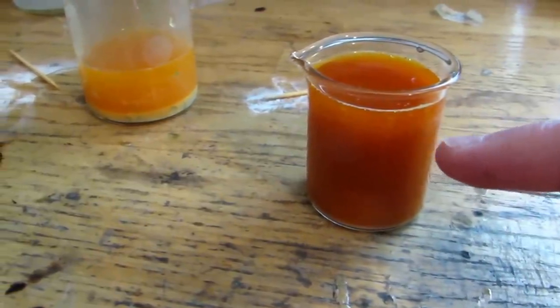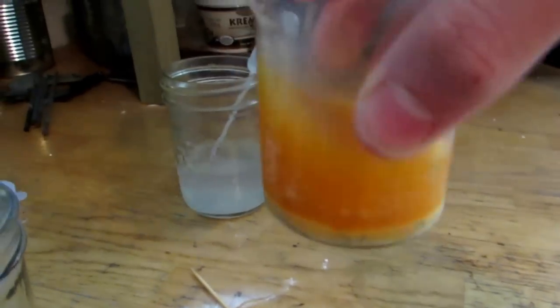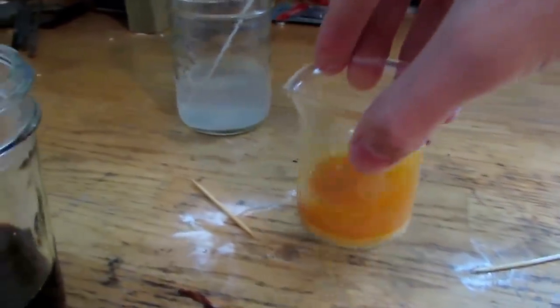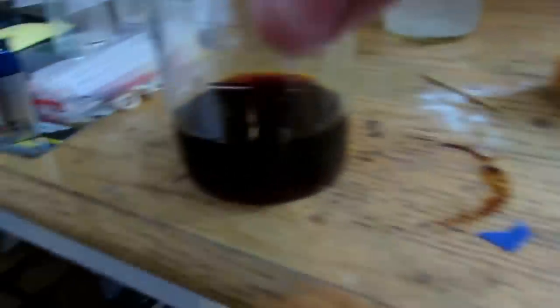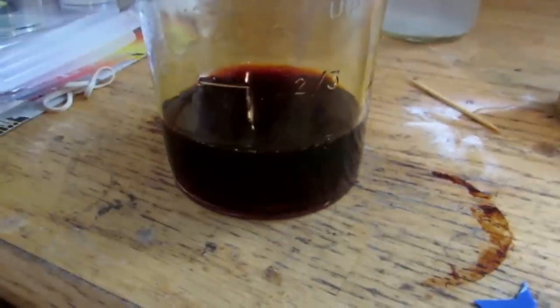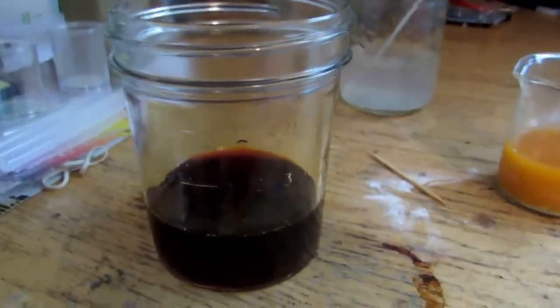So, we're going to filter this one off and keep it separate, because this contains silver metal, and when we do the displacement reaction, we're going to get an impure substance here. But this one is the pure palladium. Now, you can see it's still dissolving, and it's actually getting quite hot. It's actually dissolving the palladium out of those capacitors there. So, we're going to leave this for a bit to darken up and get all the palladium out of those capacitors. And then finally, this one. It's kind of still hard to see, but you can see it's a bit more of a brown color there. There's definitely palladium in this solution. I added quite a bit, but this also contains nickel. Now, I'm not sure if the zinc that we will be using in this process will displace off the nickel, but if it does displace the nickel, then we'll get a nickel palladium impurity. So, anyhow, this is going to be pure. This will be impure with silver and impure with nickel. So, I'm going to filter all these off through a coffee filter so that there's no little particles, and then I'll meet you back.